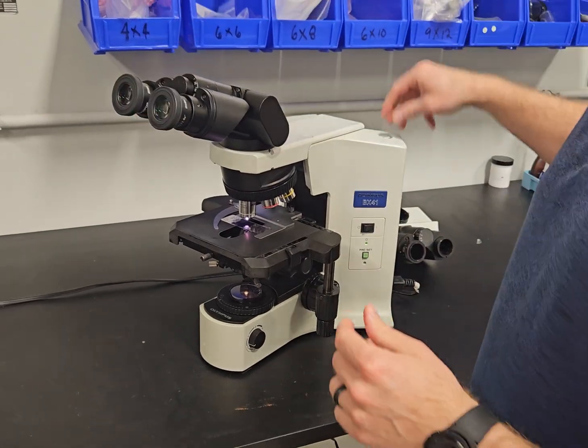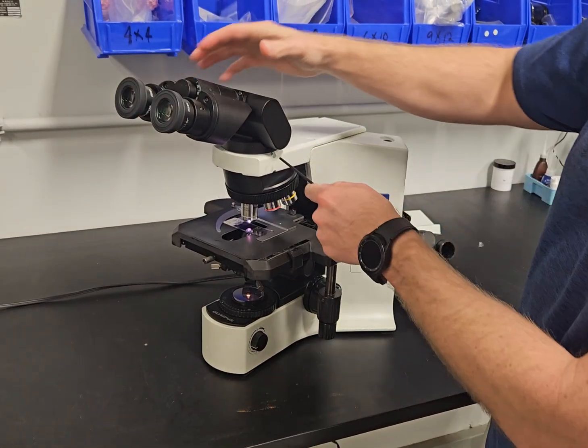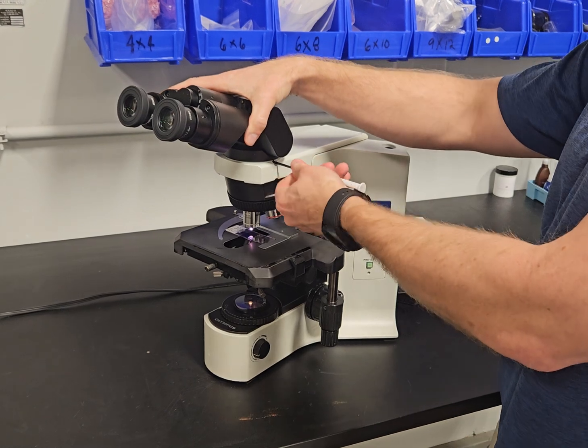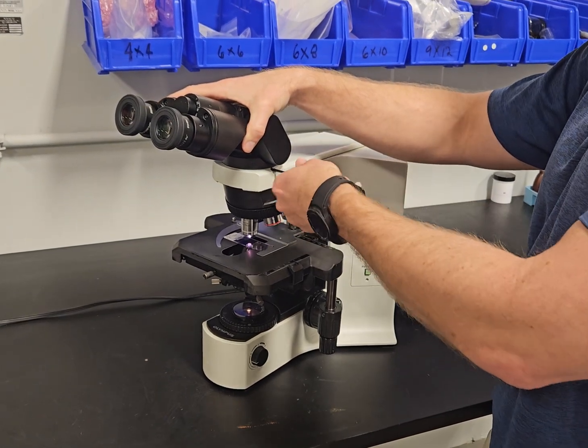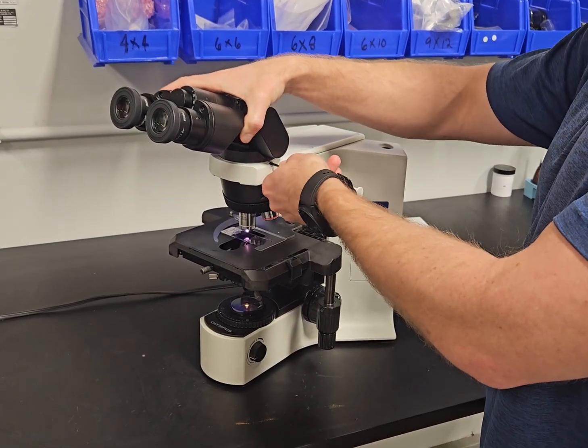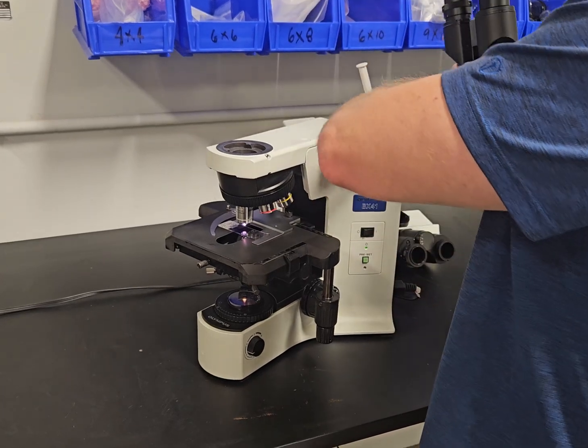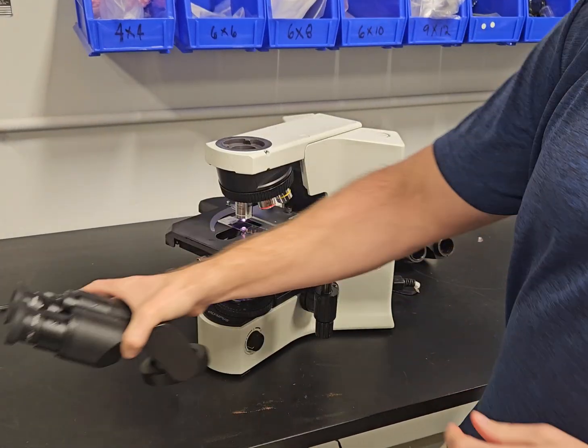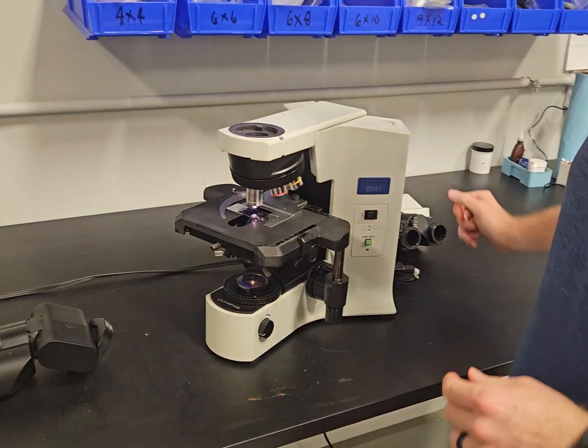Let's screw that back in. A lot of times with the reticles, you're going to put them in a focusable eyepiece and then that way you can focus in and out on the reticle and make it sharper or more sharp. We're going to take that head off and then show you another head.